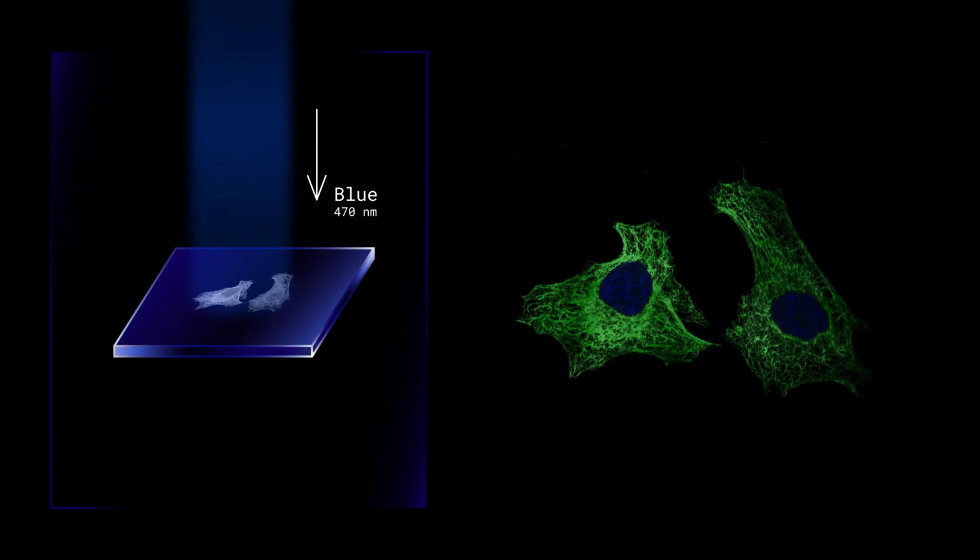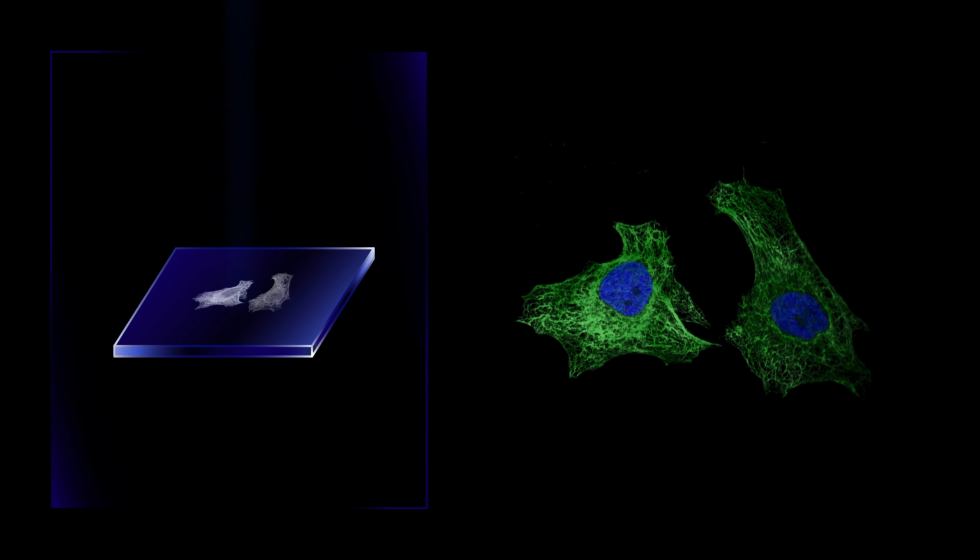Why do we use fluorescence at all? Because using this method we can see things invisible in bright field or phase contrast microscopy. Fluorescent markers, proteins or dyes bind to specific structures. For example, DAPI stains cell nuclei. Other dyes stain mitochondria, cytoskeletons or even viruses. This gives us contrast and a lot of structure information.